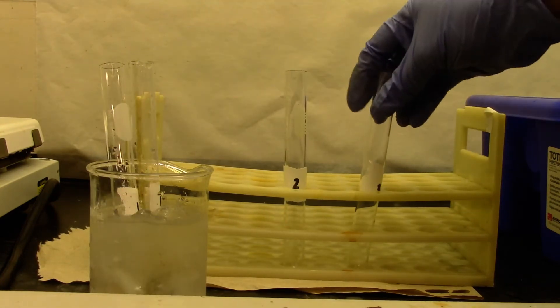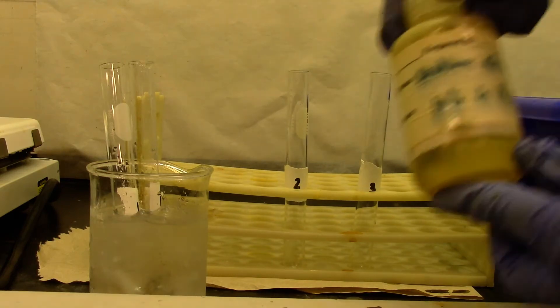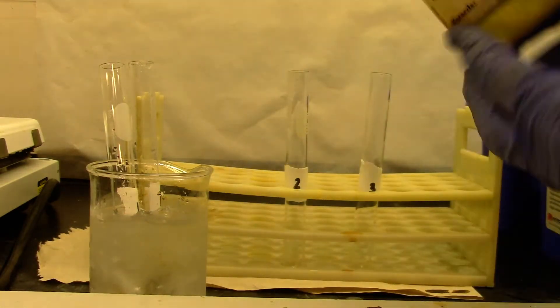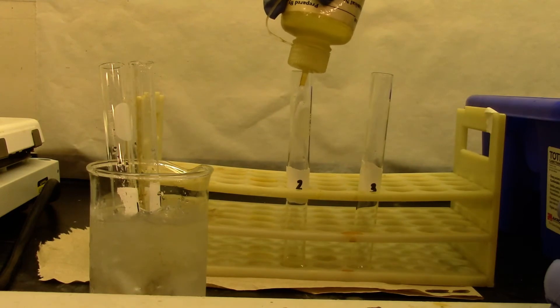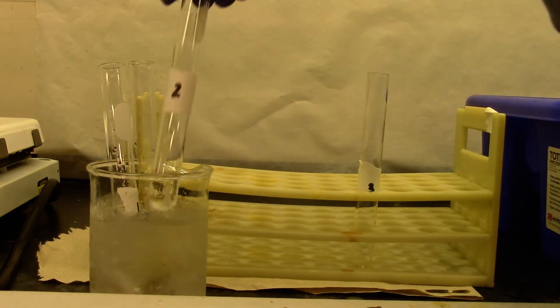Second test tube and third test tube. The second one would be sodium nitrite. It will be sodium nitrite, about 2 mL.